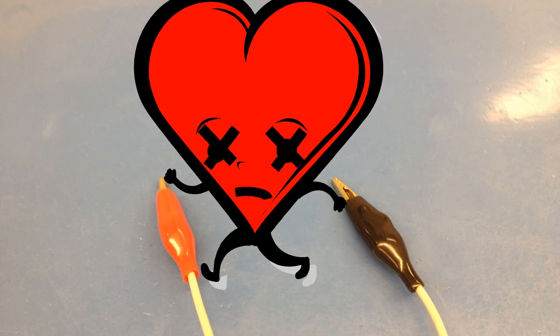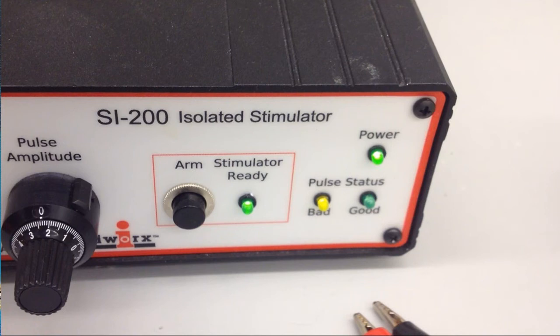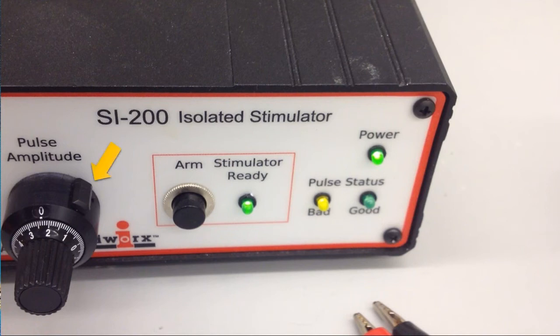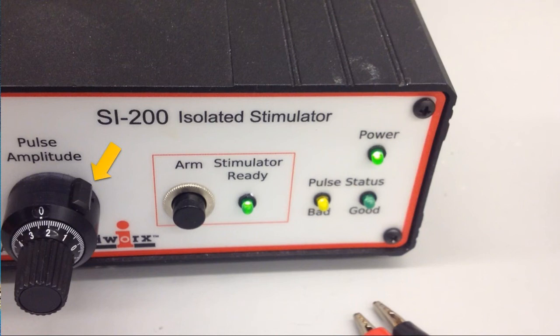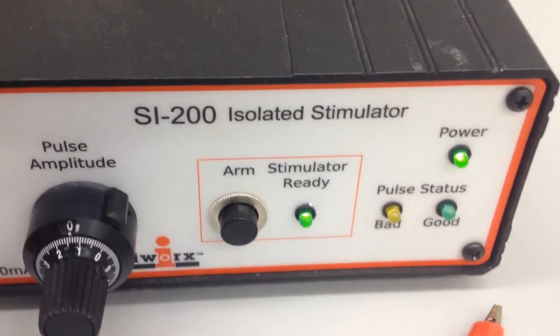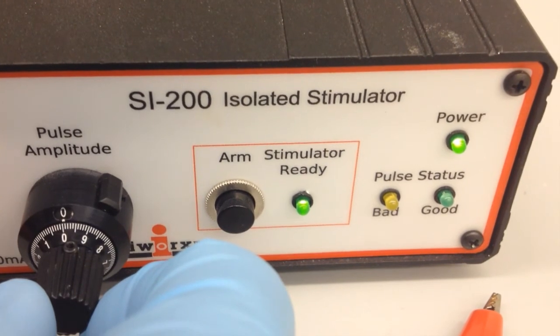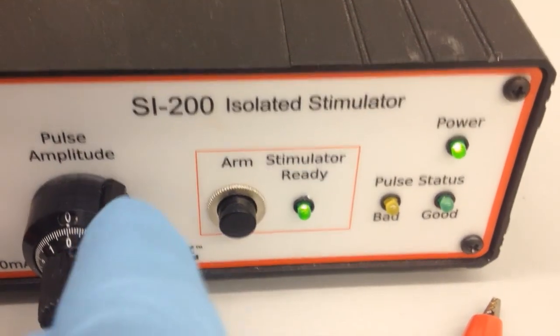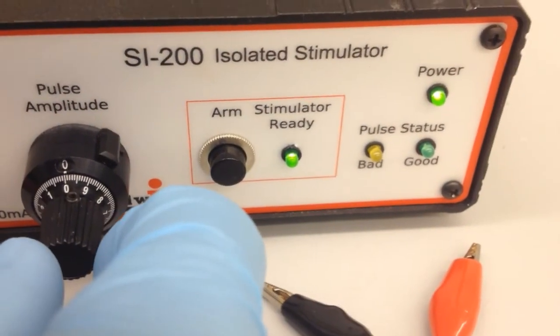Make sure the stimulator is working before you work on frogs. Run the example VI with multiple pulses. Make sure the pulse amplitude knob is not engaged — isolate the stimulator leads from one another and turn the pulse amplitude knob counterclockwise until you feel some resistance. You should see the green LED blinking faintly.